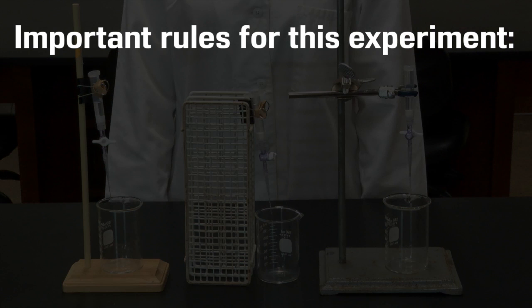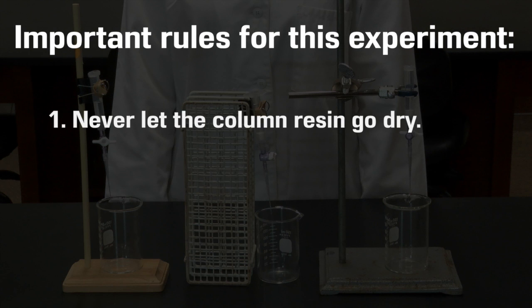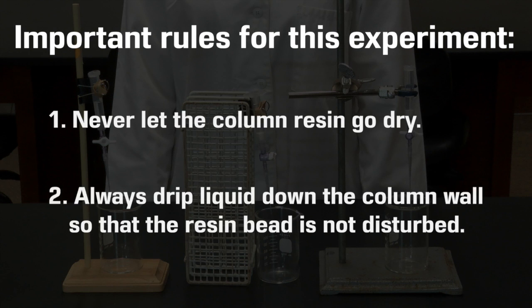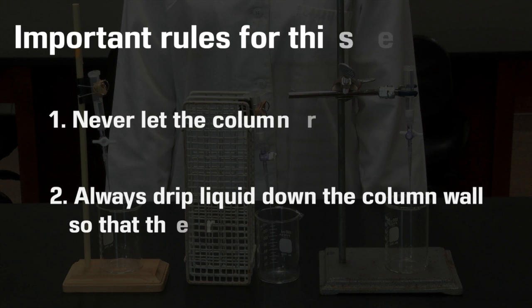Important rules for this experiment: Never let the column resin go dry. Always drip liquid down the column wall so that the resin bead is not disturbed.